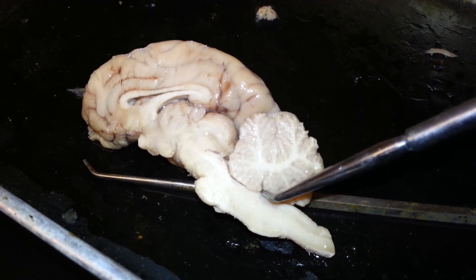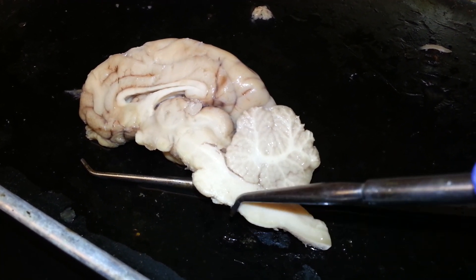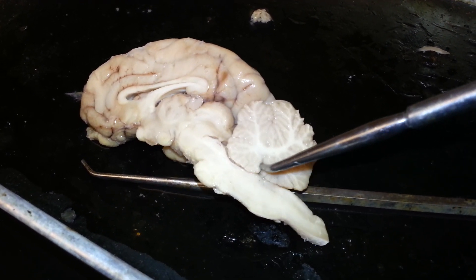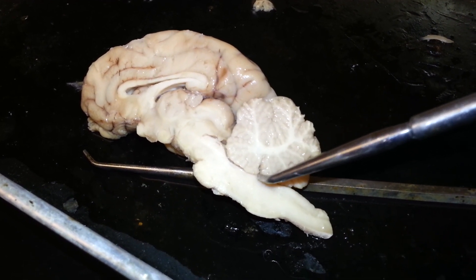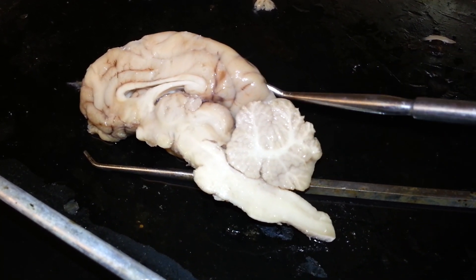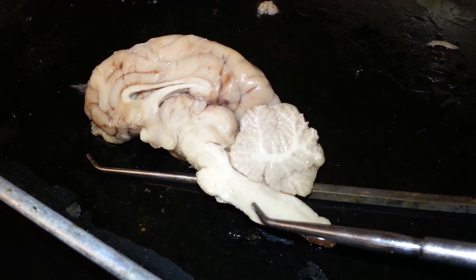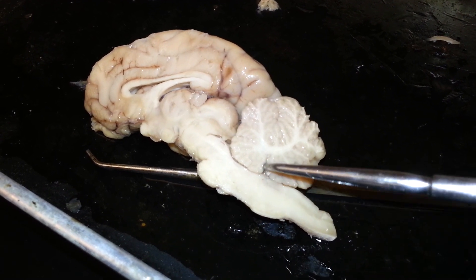You know it's the medulla oblongata either because it bumps out and that's the first bump, or because right above the medulla oblongata you have this gap right here — this gap is the fourth ventricle. So here you have the cerebellum, and in between the medulla oblongata and the cerebellum is the fourth ventricle.